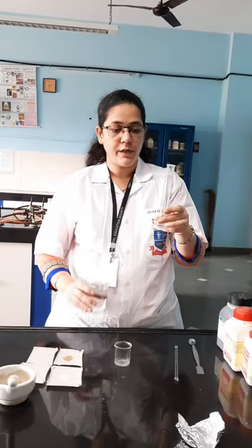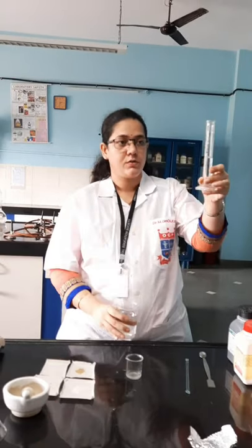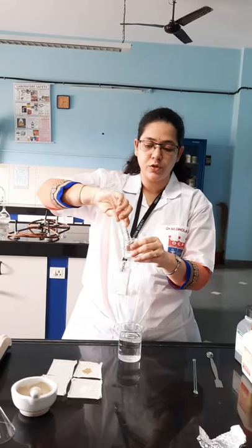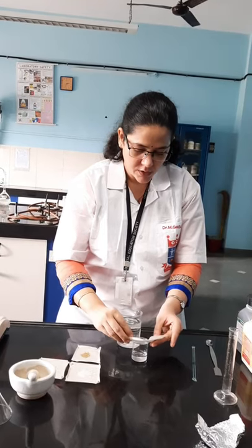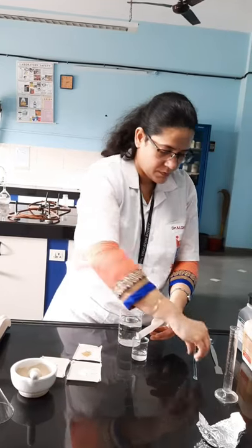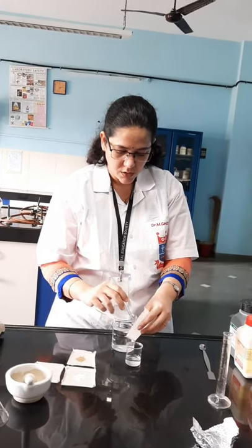We have to take three-fourths of the total water required, which comes to around 14 ml. I will use a measuring cylinder to take 14 ml of distilled water and pour it into a beaker. We have to make a solution of sodium citrate, so I will add the sodium citrate to the water, being careful to ensure all particles are transferred into the beaker.